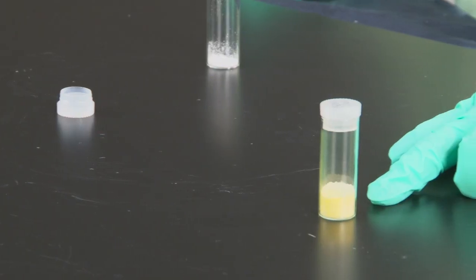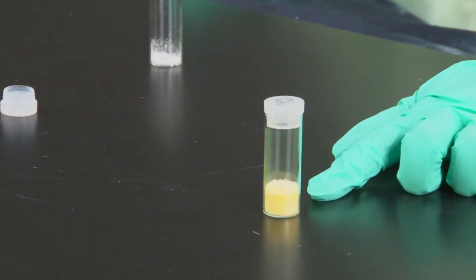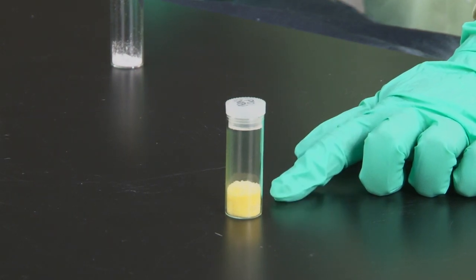As you can see, we now have some yellow solid in the vial, showing that lead iodide was produced.